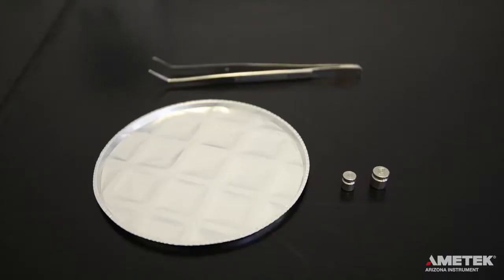To perform the weight test, you will need the three and five gram weights, a clean sample pan, and the tweezers.